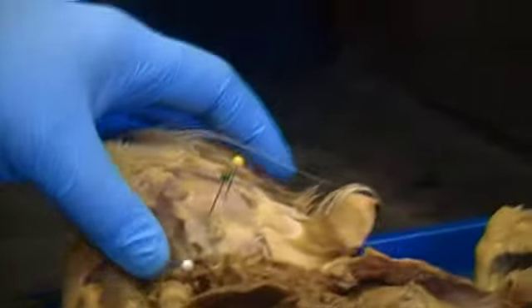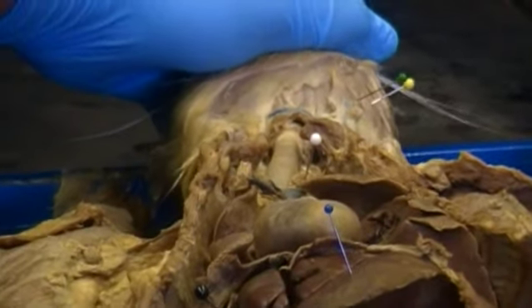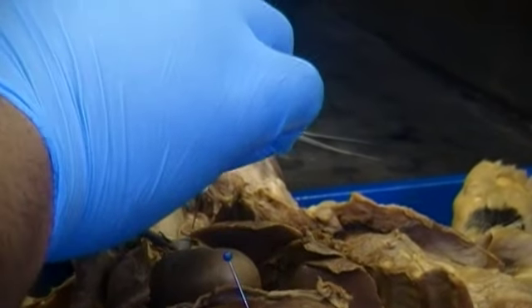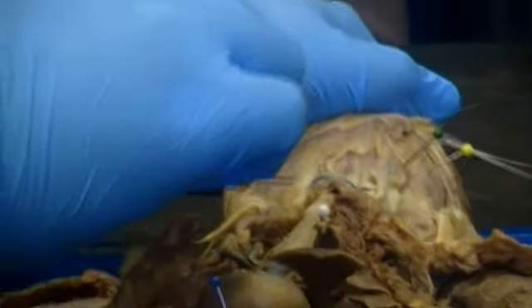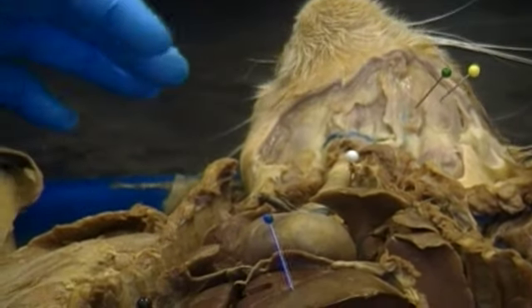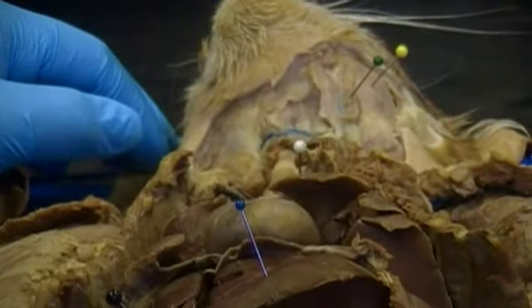One of the things I was able to find on the cat, as I was setting this up to show you the digestive structures, is this blood vessel right here that is actually connecting this jugular to this jugular. So that is the transverse jugular.